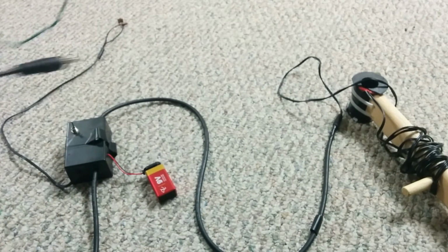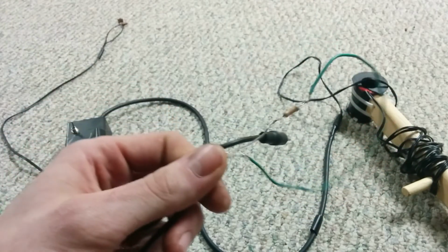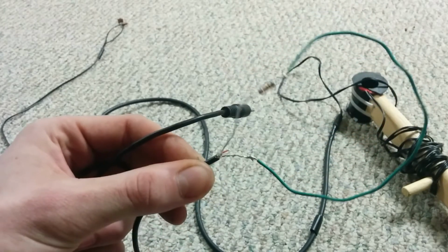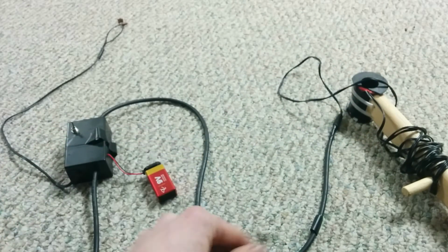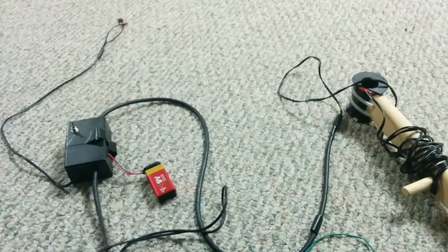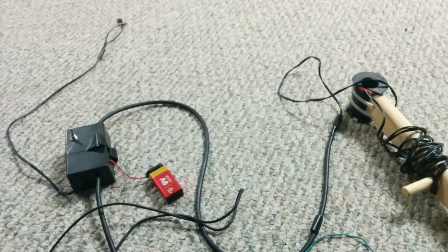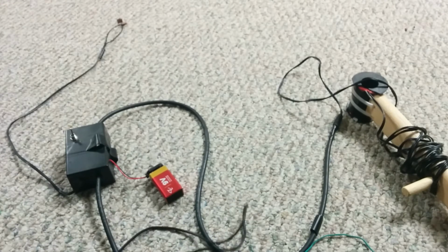Okay, so when I was testing this thing, I made this little cable. It's one of these aux cables, and it's got a 10K resistor to a little piece of wire loop. And so that allows me to create a little signal from my smartphone, and we can just test the sensitivity of this thing. So this is the piezo here, and it's meant to be an earpiece, so I'll hold it close to the phone, but I'm going to feed this with the tone here. And so this is nearby. I didn't actually tune this. It's 2220. It's pretty close.